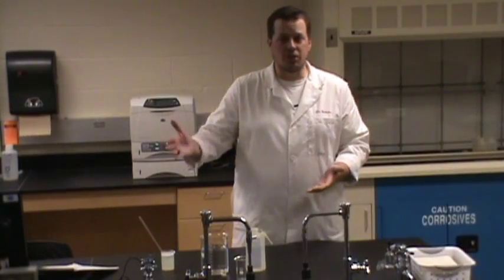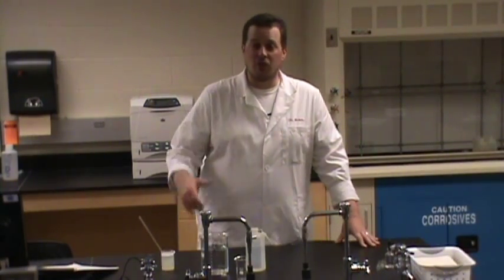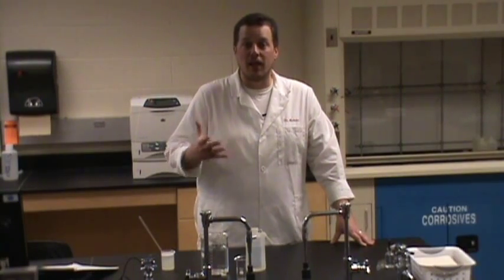This week in lab we're going to change gears just a little bit. So far this semester we spent a lot of time looking at very quantitative experiments — meaning they deal with numbers and measuring numerical values. This week and next week we're going to change that up and look at a qualitative experiment. Qualitative experiments are all about making observations and coming to conclusions based on those observations, so it's very much in the spirit of the scientific method.